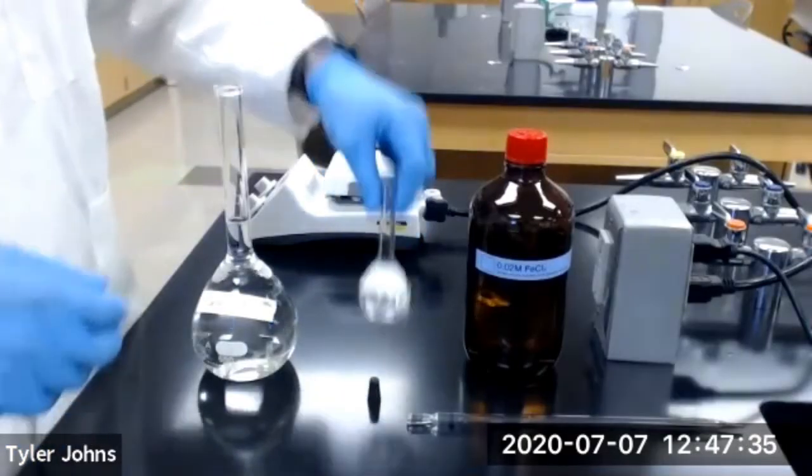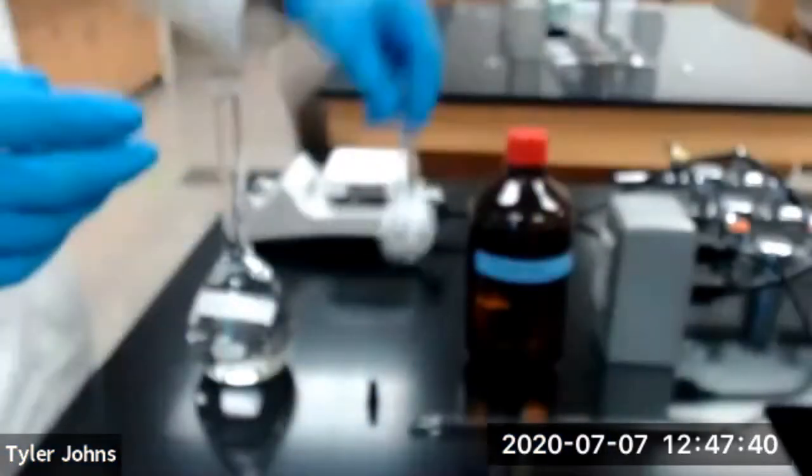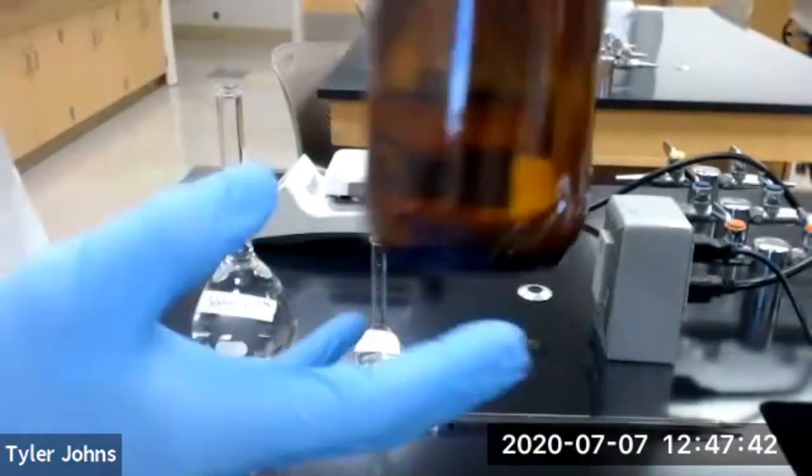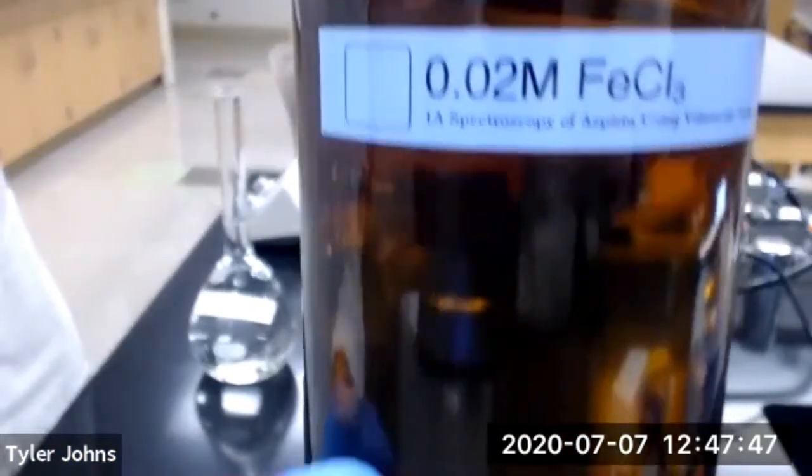We're then going to fill our 50 milliliter volumetric flask to the mark using our 0.02 molar iron chloride solution.